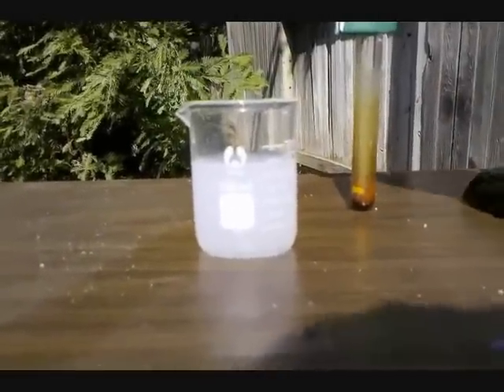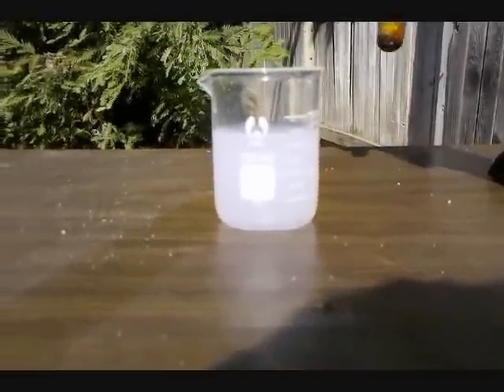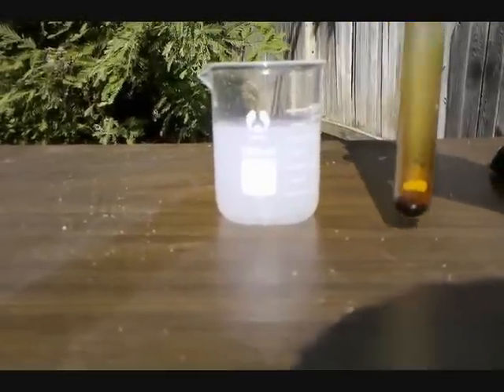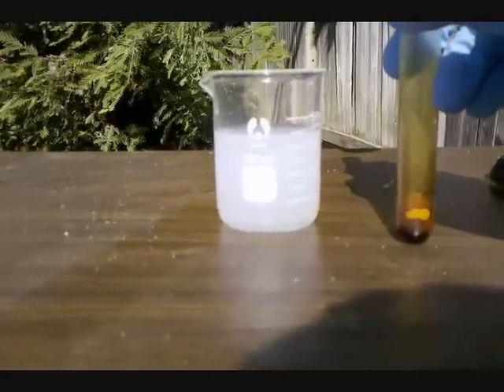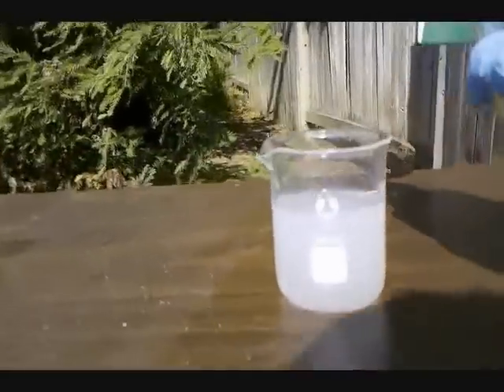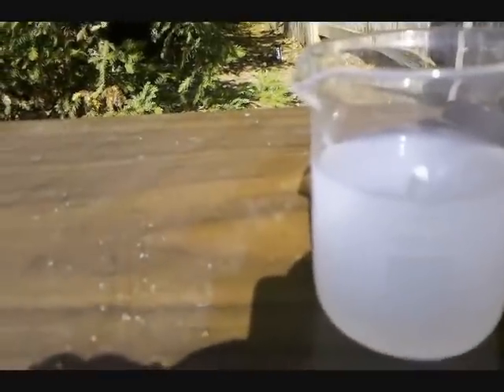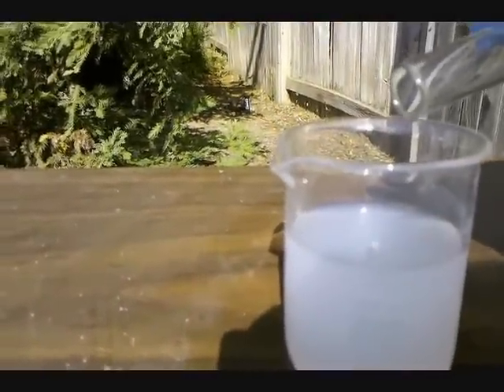To dispose of the iodine monochloride, I'm going to be pouring it into sodium thiosulfate solution, because that is how you neutralize bromine, and therefore it should behave the same. So, the liquid is poured.